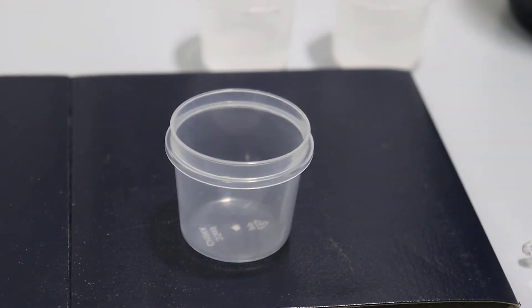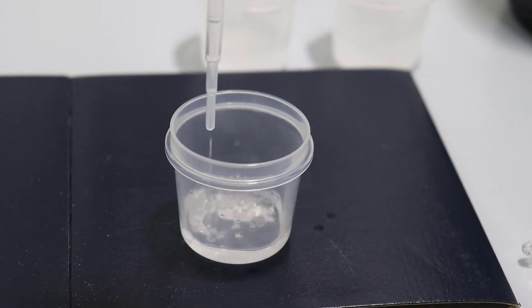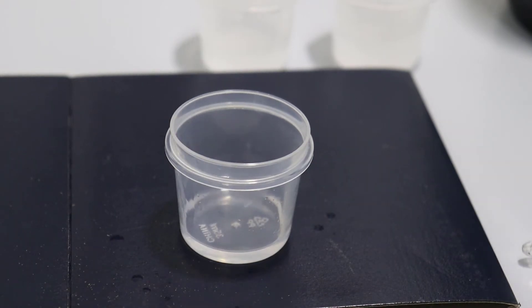Welcome back. What we're going to do here is make some sol-gel materials with tri-ethoxy-methylsilane. It's got three ethoxy groups on it and one methyl group. The ethoxy groups are going to fall off, making ethanol, and the methyl group will stay on there. What's left will then cross-link to form something like silica.